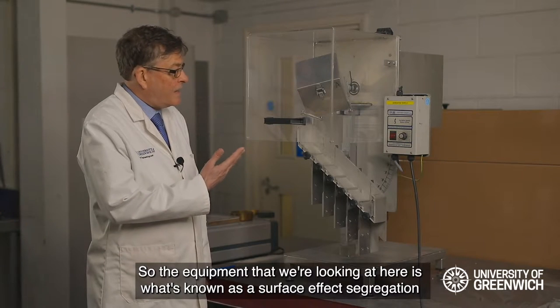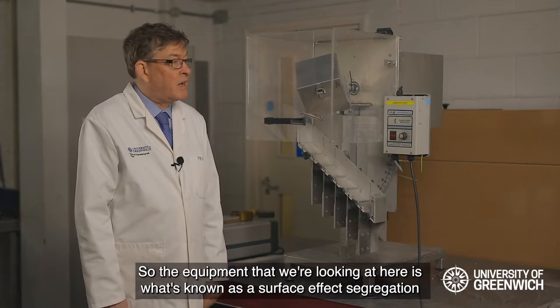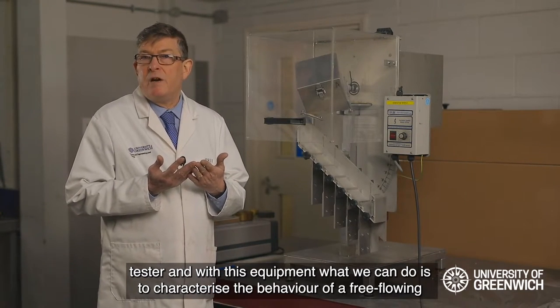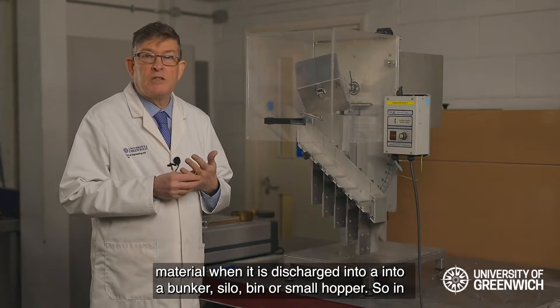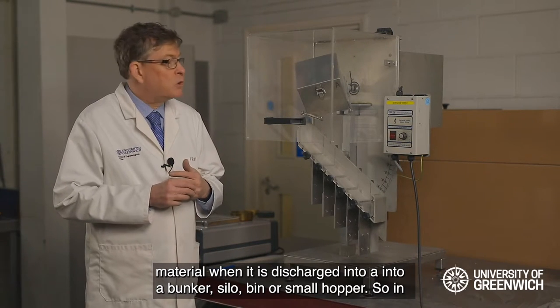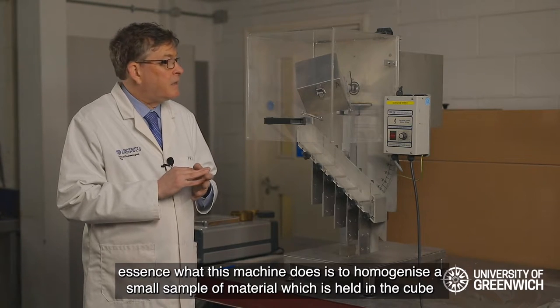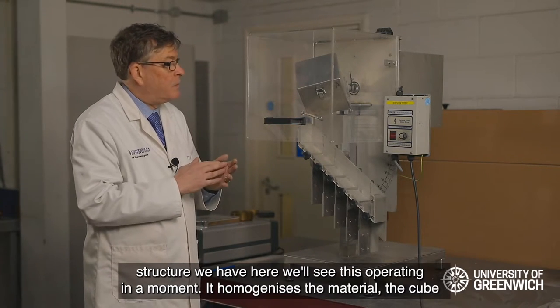The equipment we're looking at here is known as a surface effect segregation tester. With this equipment we can characterize the behavior of a free-flowing material when it is discharged into a bunker silo or small hopper. In essence, what this machine does is homogenize a small sample of material which is held in the cube structure we have here.